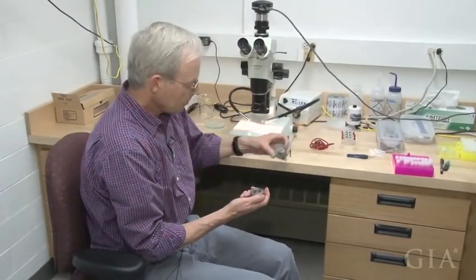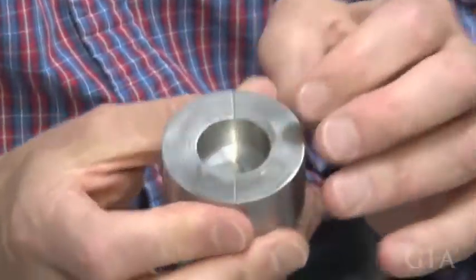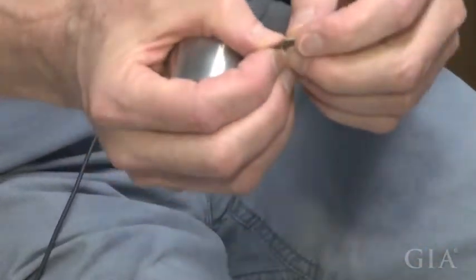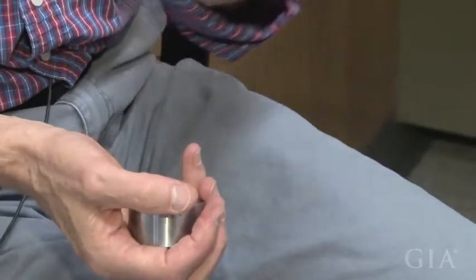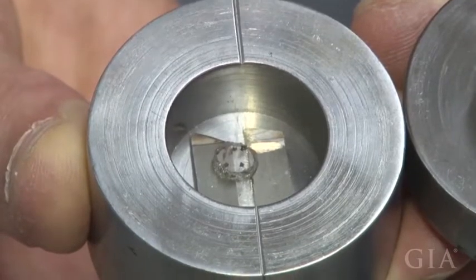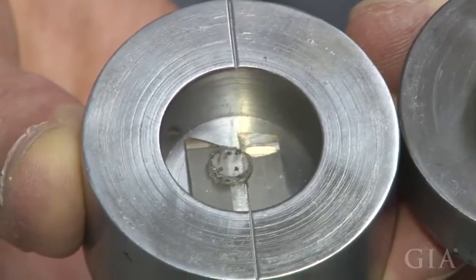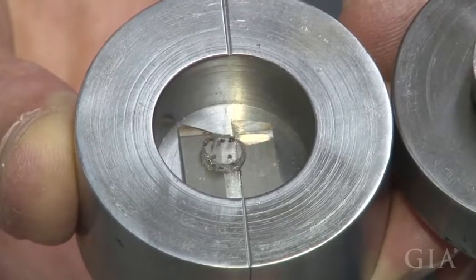Here's the bottom of the cracker — I have two lines here. What we take are these little pieces of tungsten carbide, a very hard material, much harder than the steel. These are little flat tungsten carbide lathe bits from the machine shop — not very expensive because they're made en masse — little thin wafers. We put them in like this and orient them so there's a parallel gap that we line up with the score marks on the outside of the cylinder. We try to put the inclusion directly over the gap between the two plates.